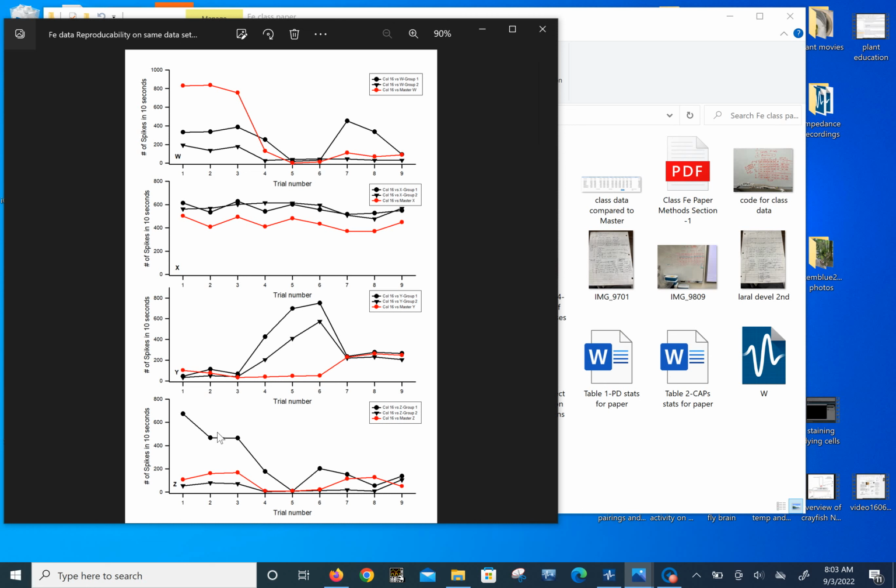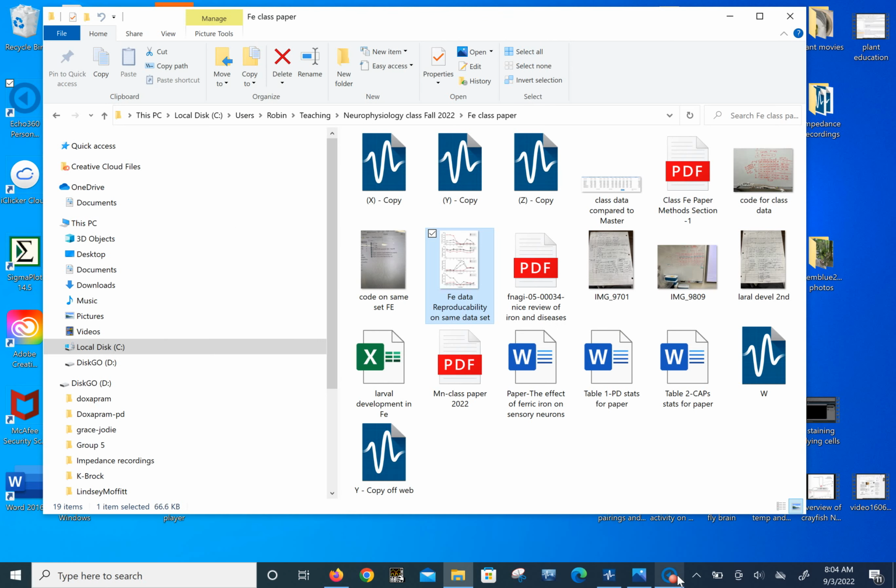So this is a good example of showing the automated analysis is not a great idea in this software. And you know, you assume it would be. You use the same standard deviation and you're using the same traces, same recording, but you can see how that could easily be messed up. Okay.